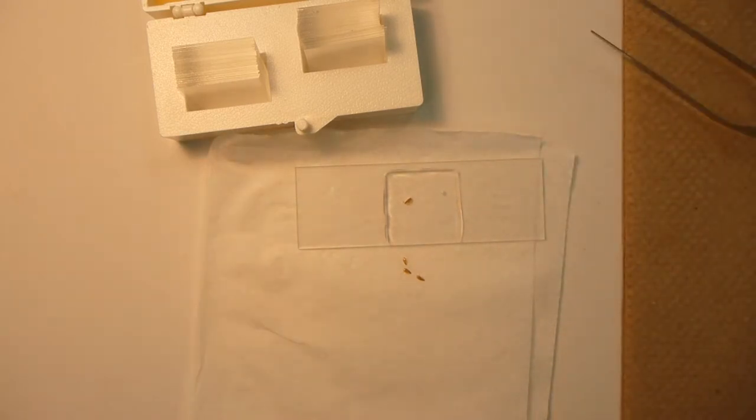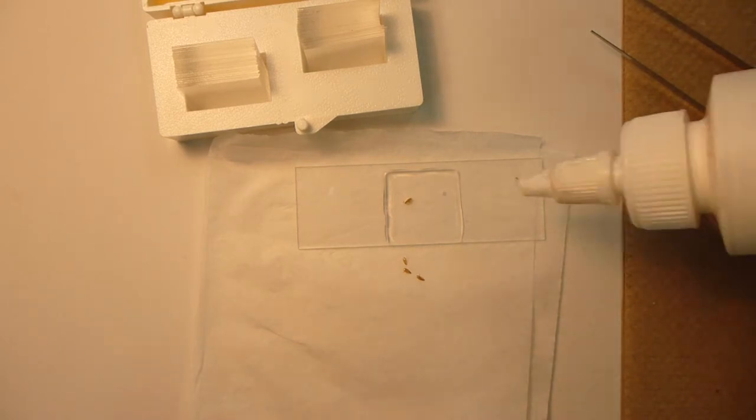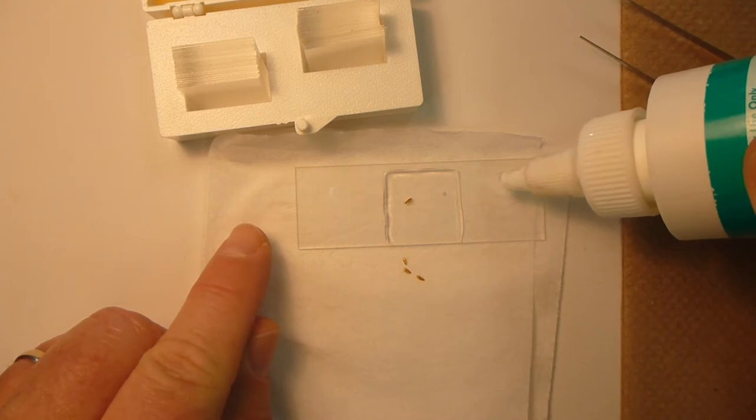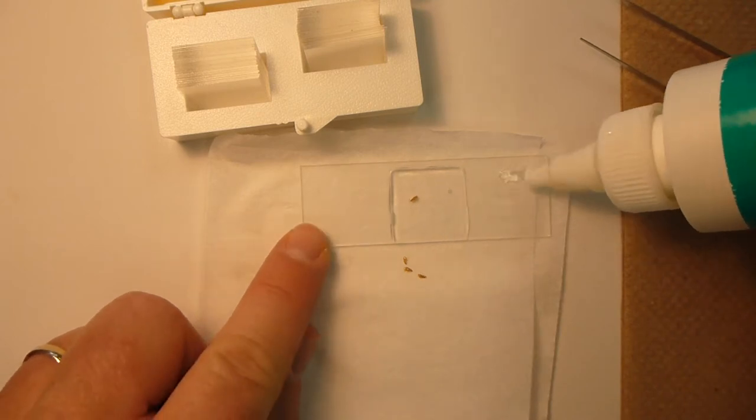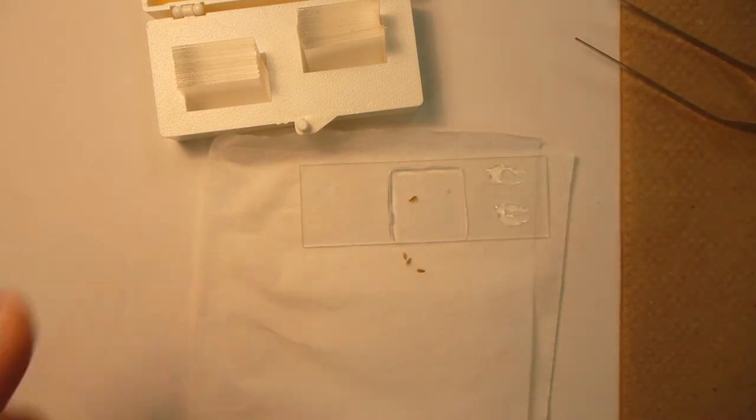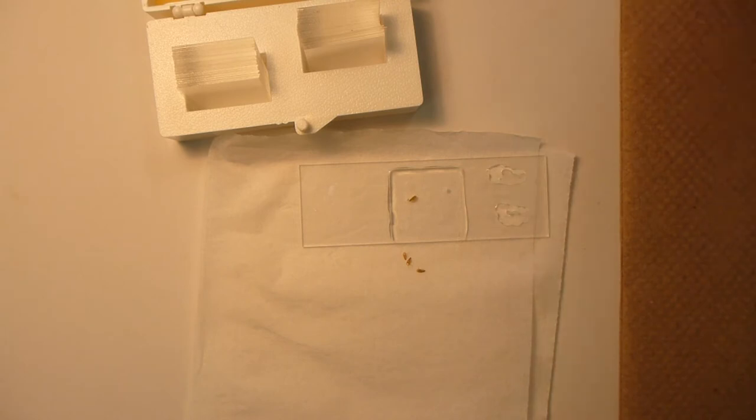The other thing that we need to do is add the locality and identification labels. And so if you have those, you just simply take the same preservative, same glue, make a couple spots over on the one end. I tend to like to go to the right side of that preservative.